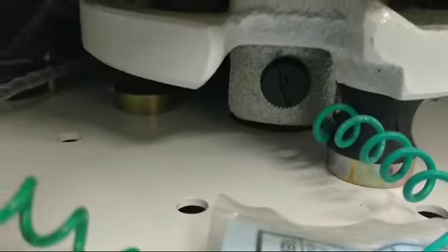One is removed from the back. Then put it back. And nothing is wrong. Thank you.